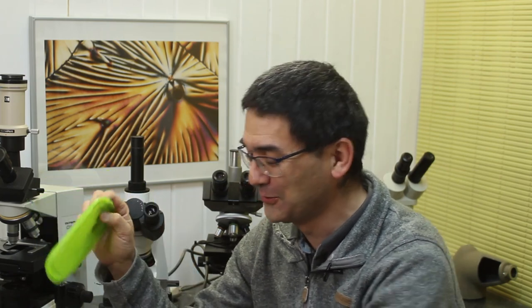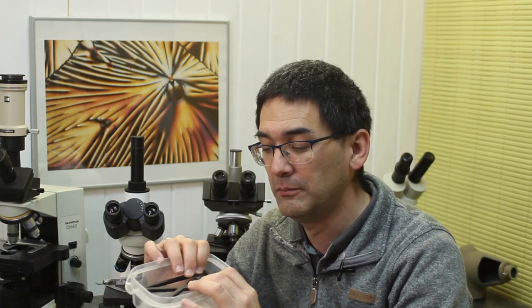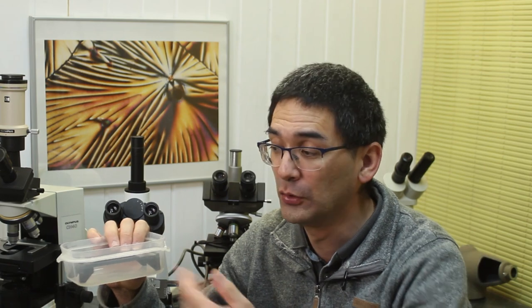I've already tried it out, of course it works, but there is a little bit of an issue as well. It's not a big problem. It actually works not perfectly, in the sense that sometimes water condenses on the lid and starts to drip down on the slide. I still have to find a solution for that. But in any case, I just want to recommend that you also somehow make yourself something like this, because it's very practical. Because you're able then to store your microscope slides for a longer time, and then you simply can continue your observation session of the same slide. Yeah. After many hours, after a day, maybe even after a week.